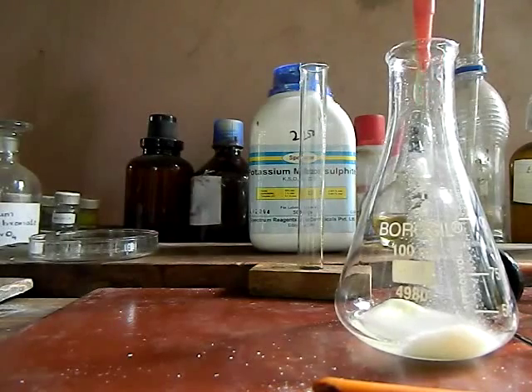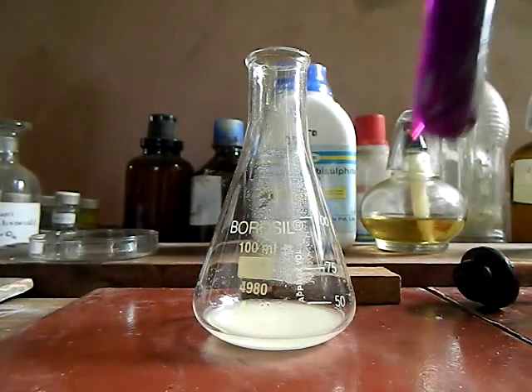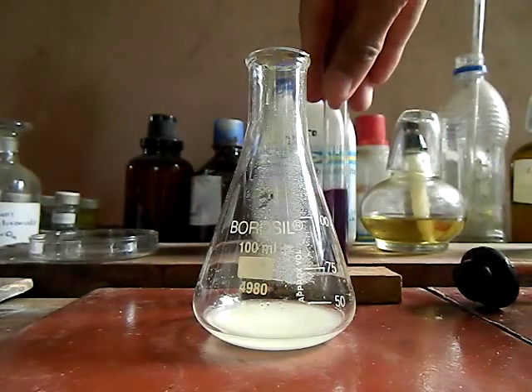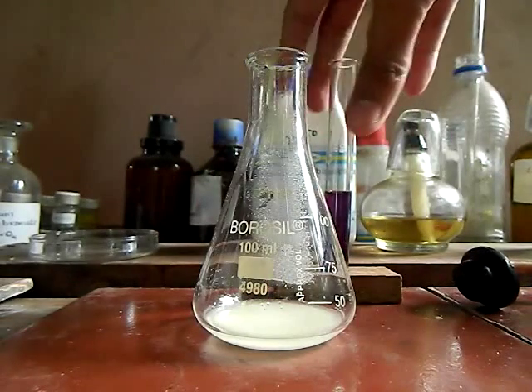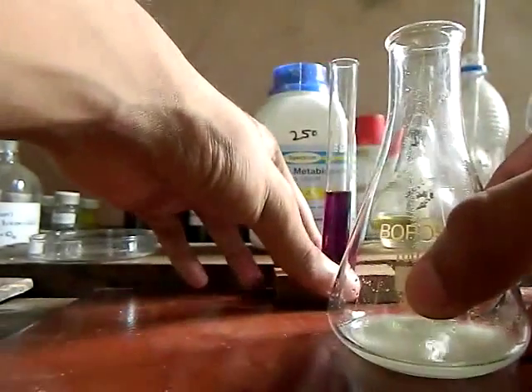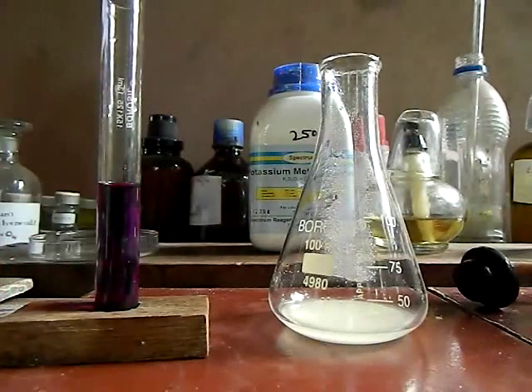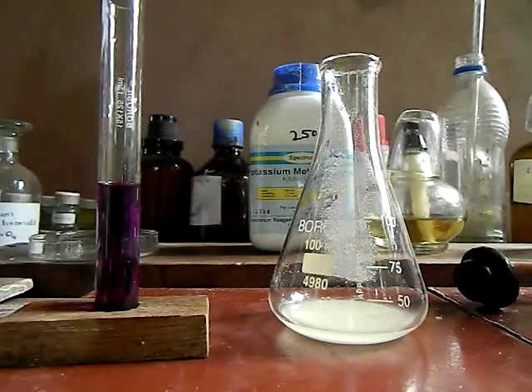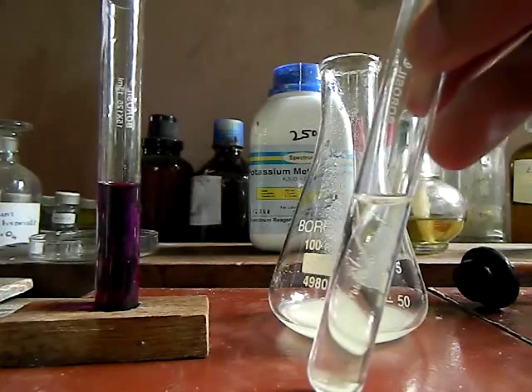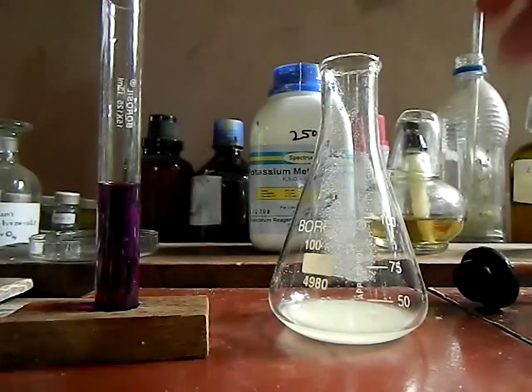Now when we add the acid, suddenly the reaction takes place and a lot of gas evolves and escapes, so we need to collect that gas soon. I have already taken the potassium permanganate solution here in the test tube and added the gas tube.